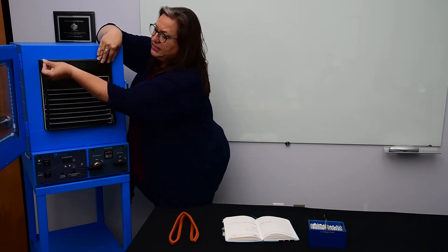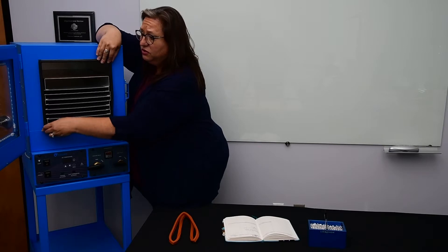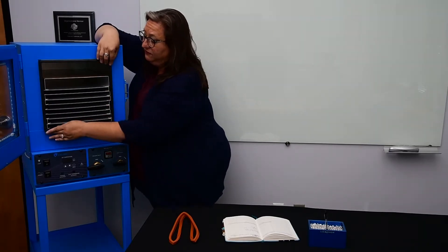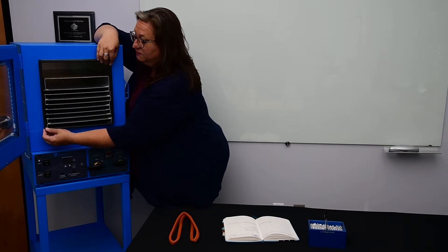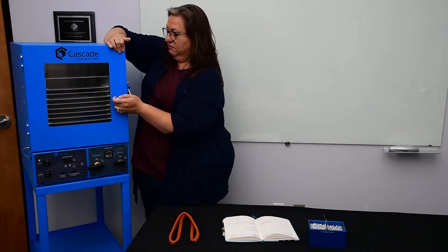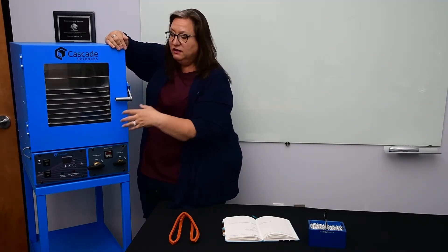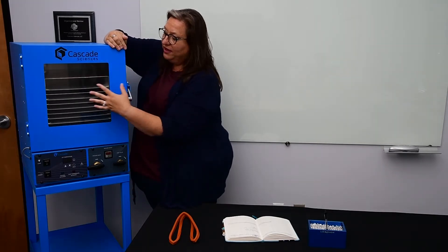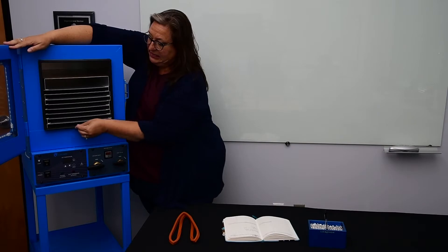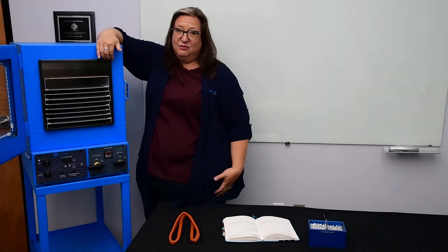Because the door is our actual sealing surface, and because of the window the door is going to be cooler, it is possible to get condensation on the door if you're running the vacuum oven not under vacuum. In applications where you might have some product just sitting in the oven being exposed to heat or off-gassing a little bit prior to vacuum processing, if you're not running under vacuum you may get condensation on the window. That condensation is going to drip right down the glass and bleed all over the gasket, pool and puddle, and it will degrade your gasket.